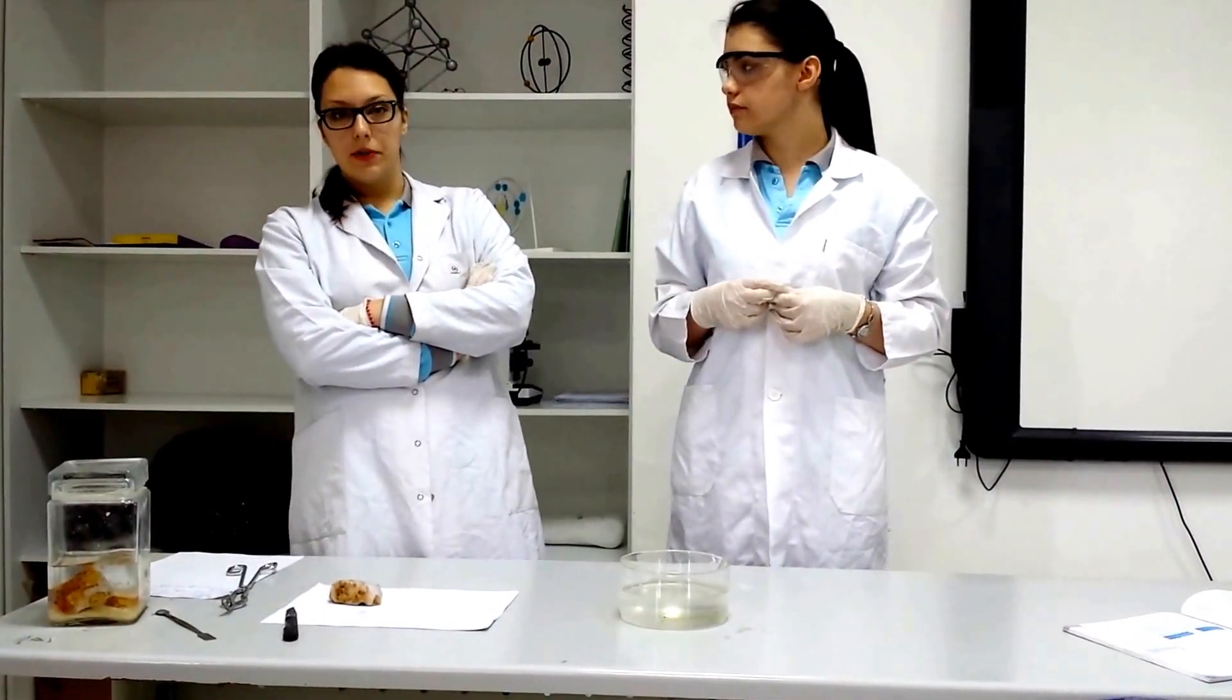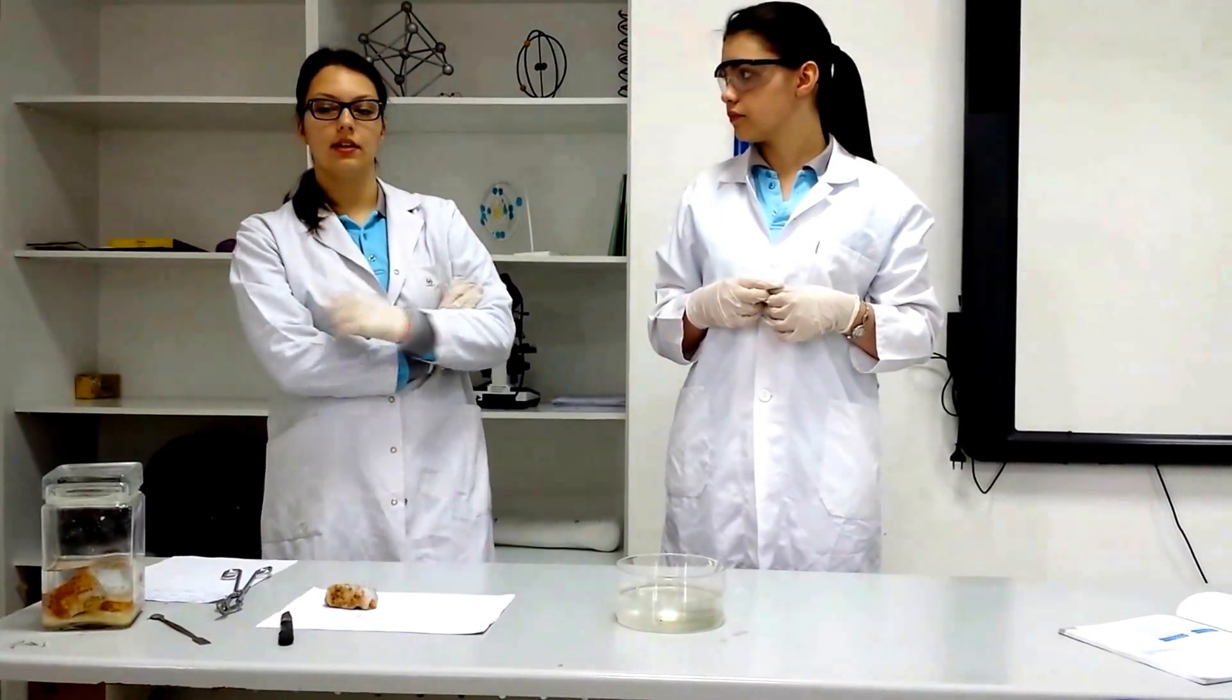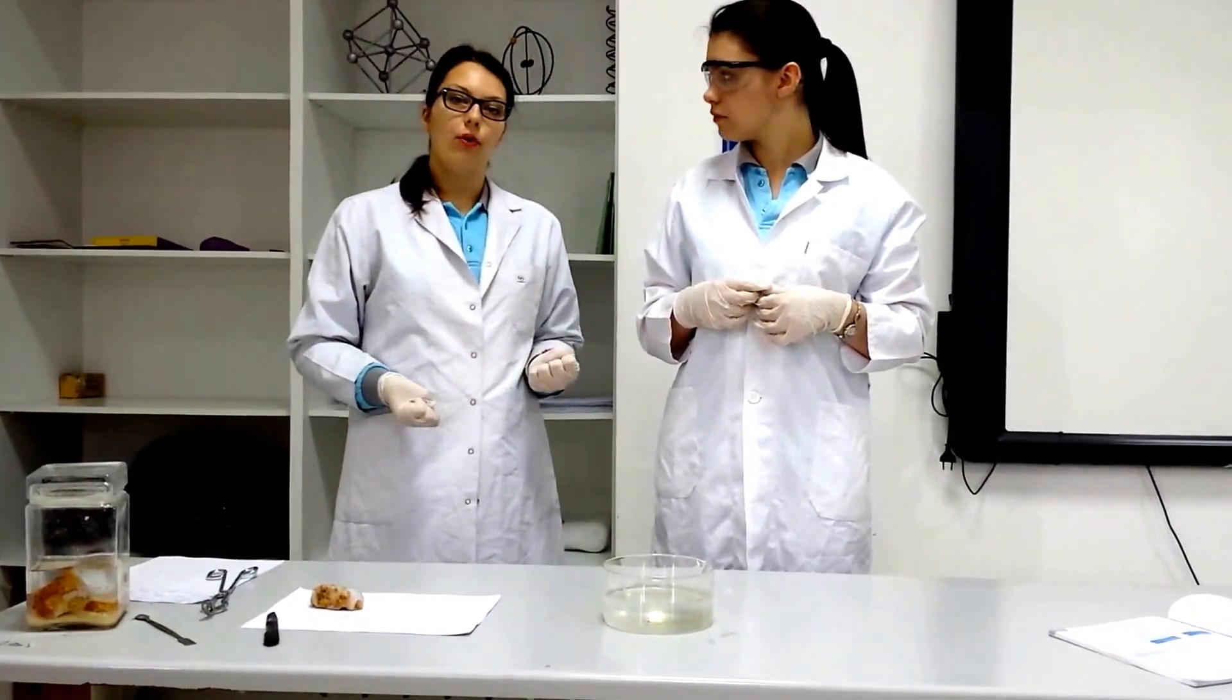With this experiment we are going to show you the reaction of water and sodium.